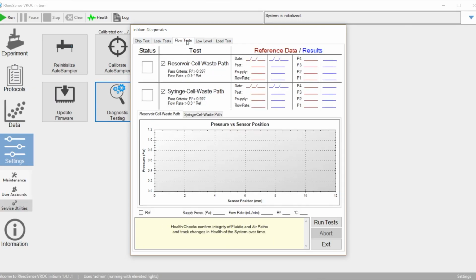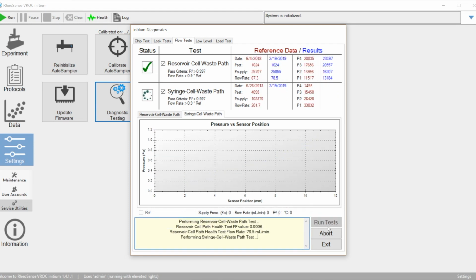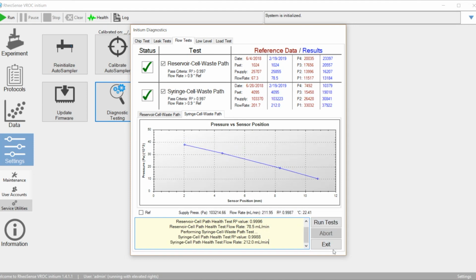So after the syringe cell path leak test, you're going to want to go up to the Flow Test tab, and you're going to run both the reservoir cell waste path and the syringe cell waste path. Both of them are already pre-selected, and you can just click the Run Test button. If all 3 tests pass, then you're good to go and start using your Initium.